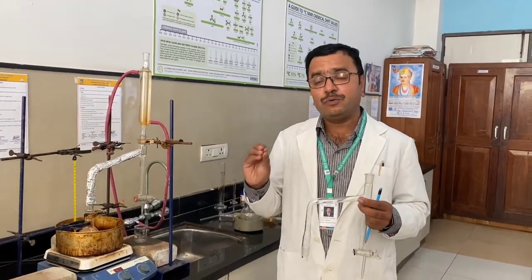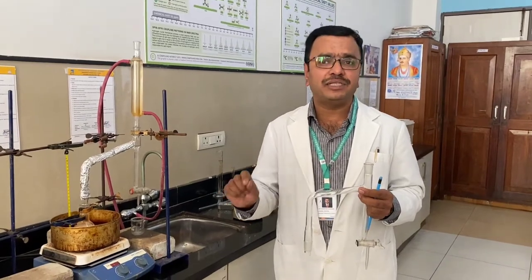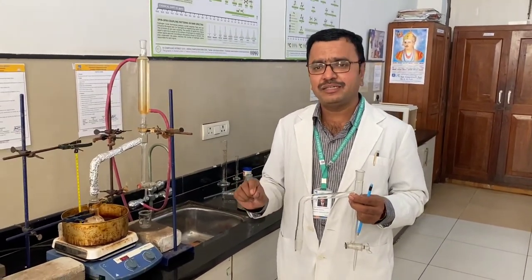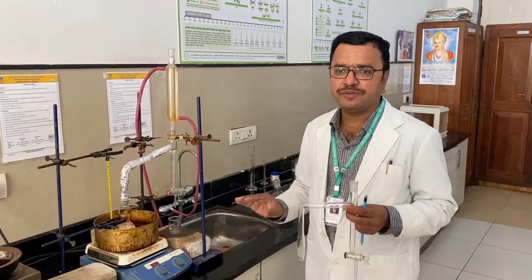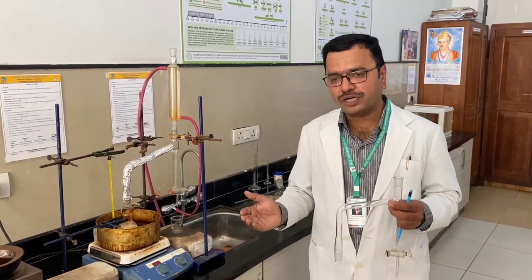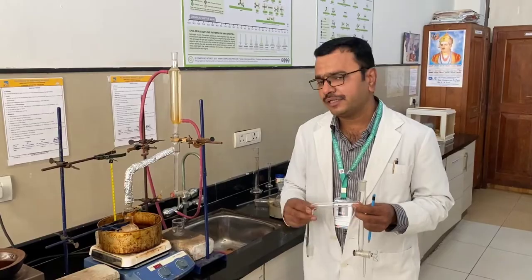What is the application of the Dean-Stark Apparatus? The application is the synthesis of Schiff base. In a Schiff base reaction, water content is the by-product of the reaction mixture. If you remove the water content, the reaction is going to be driven forward. Thank you.